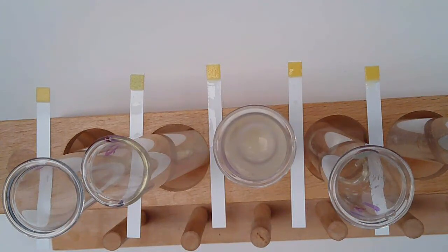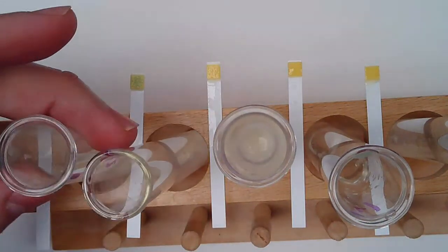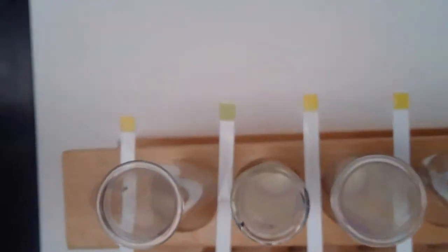Now, we should be able to think a little bit, well, which one would we expect to have a color change? Well, in theory, lactase is designed to break down lactose. So I should be able to see it in there. And I'm not sure if you can start seeing it, but it looks like we may have some presence of glucose in one of these. So we'll take a look at number 1, number 2, number 3, and number 4. And if you want, I can probably get us in a little bit closer and get a little more focus.